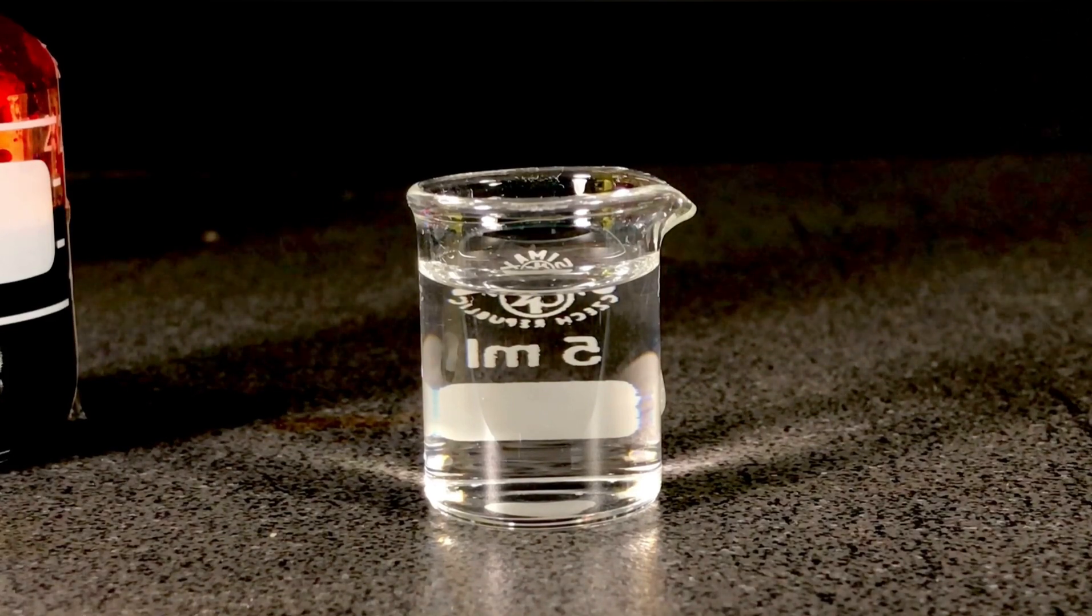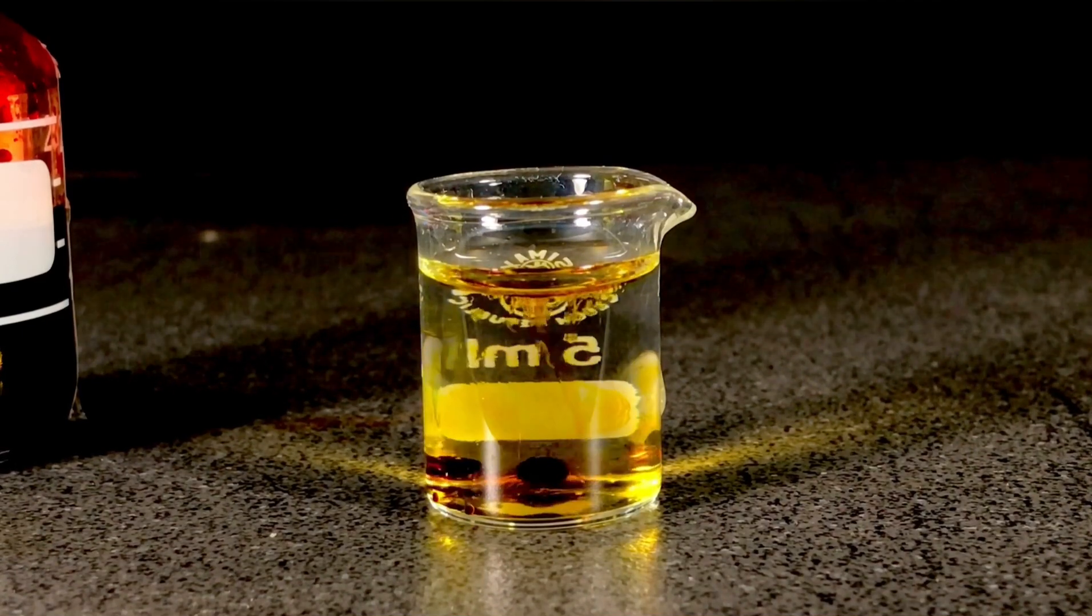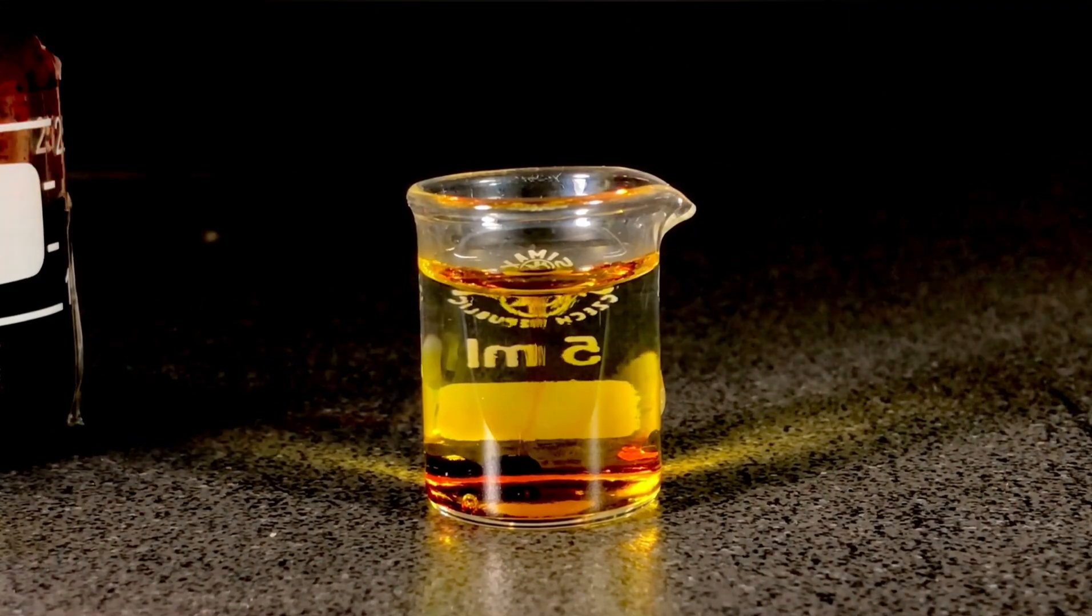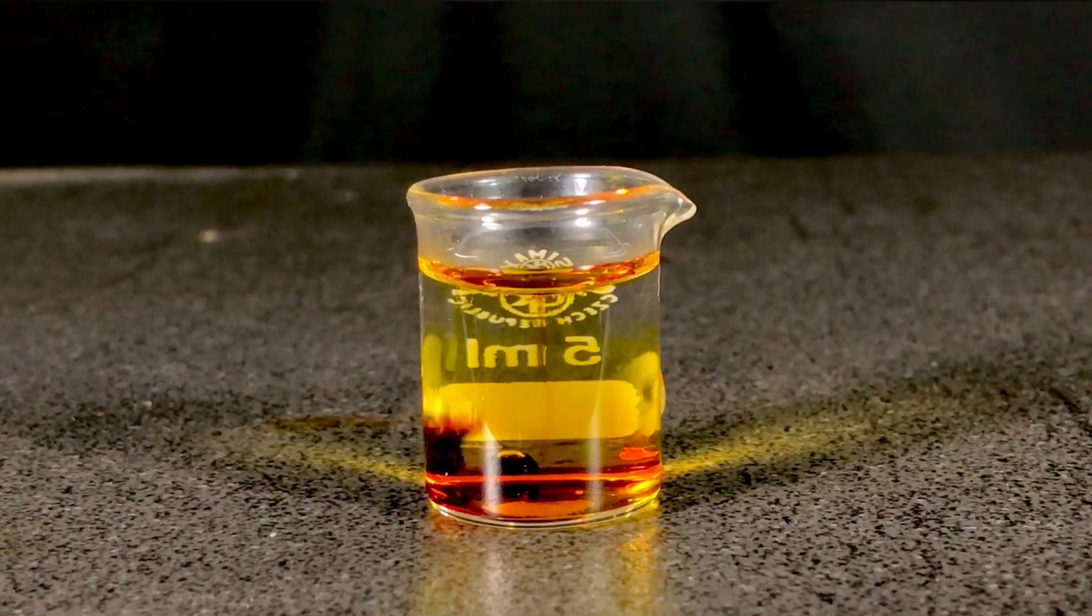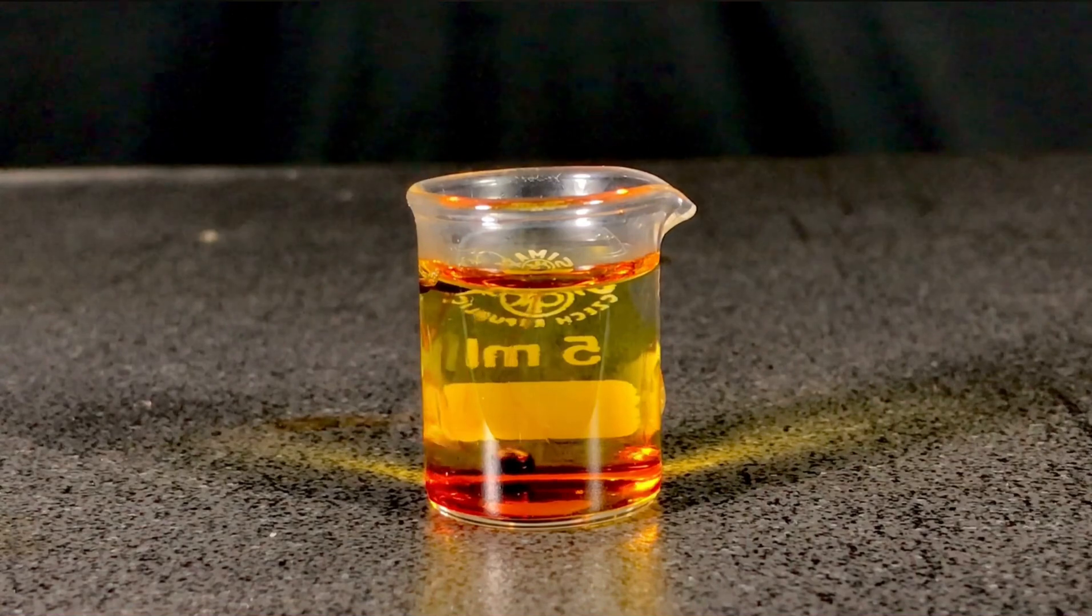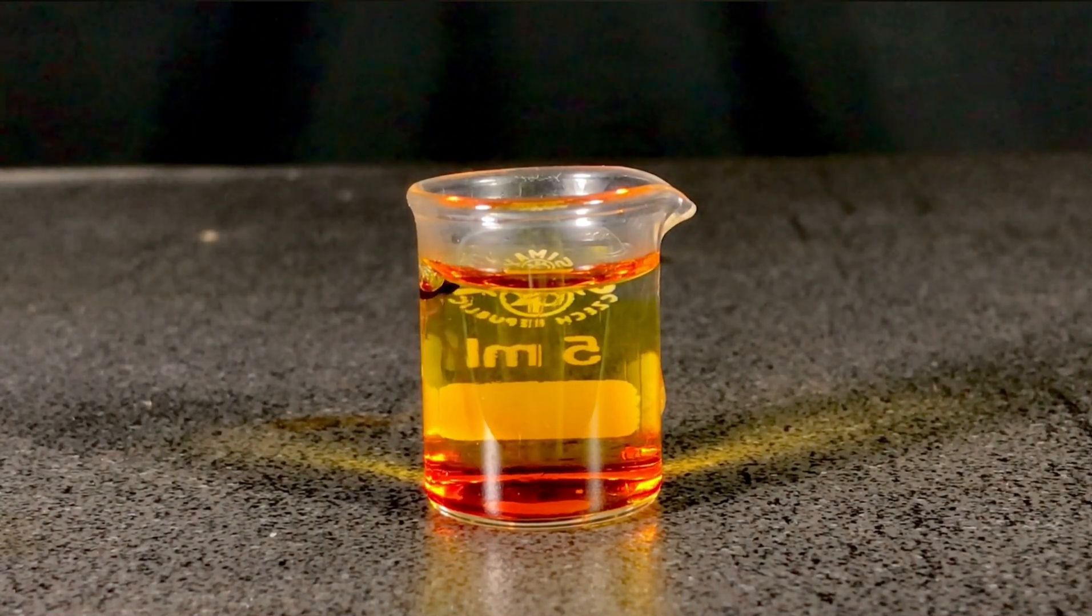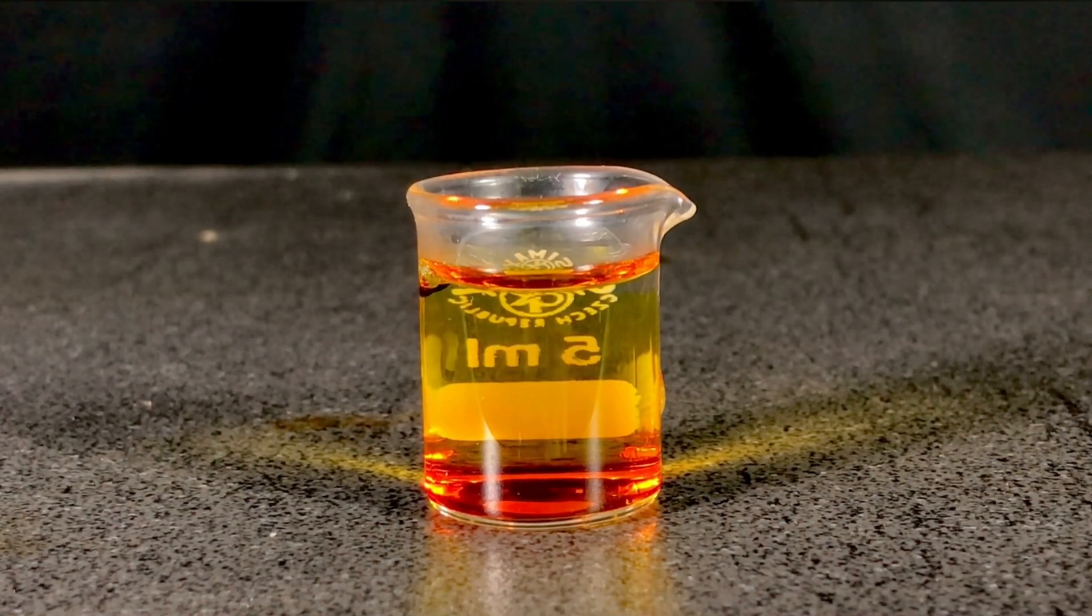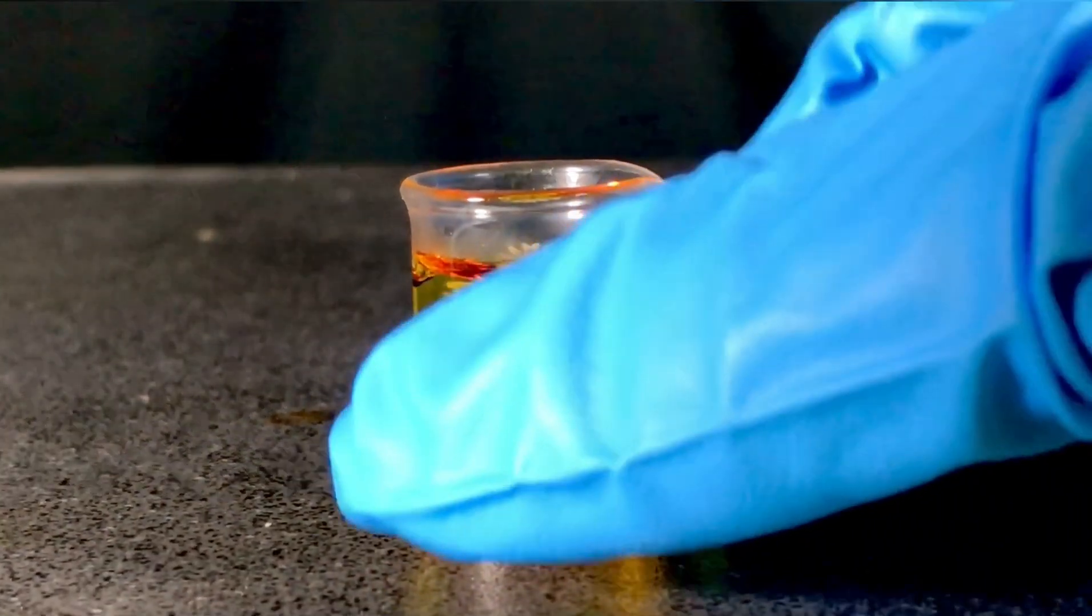Now we are going to try out a few reactions. This is distilled water. When chromyl chloride is added the few drops directly sink to the bottom. With water chromyl chloride reacts to form hydrochloric acid and chromic acid. Chromic acid has chemical formula H2CrO4. The bubbles you can see here when you look closely are hydrogen chloride. They sort of float on top of the chromyl chloride and make this lava lamp like effect. But sadly the chromyl chloride decided to stay on top of the beaker.